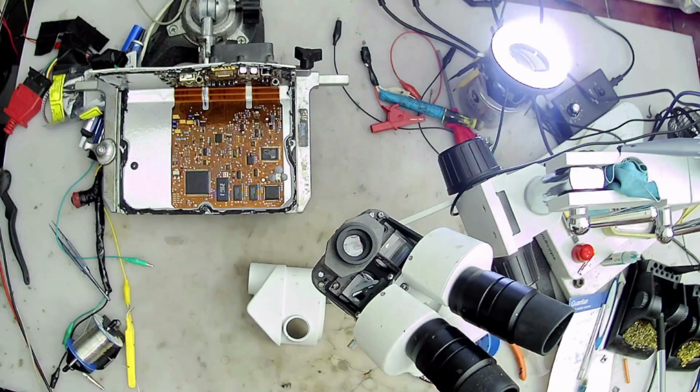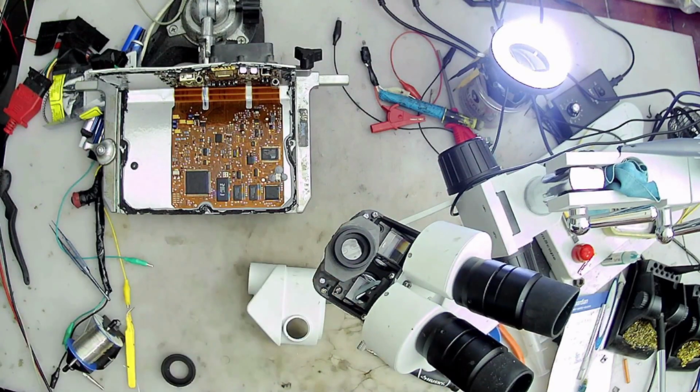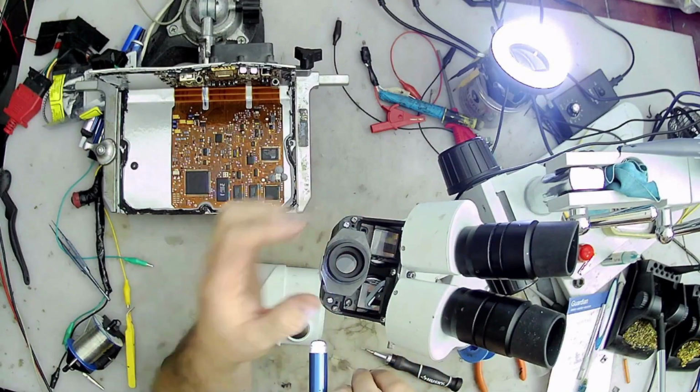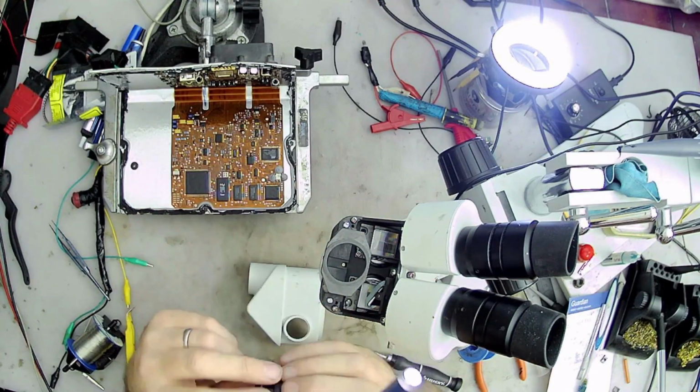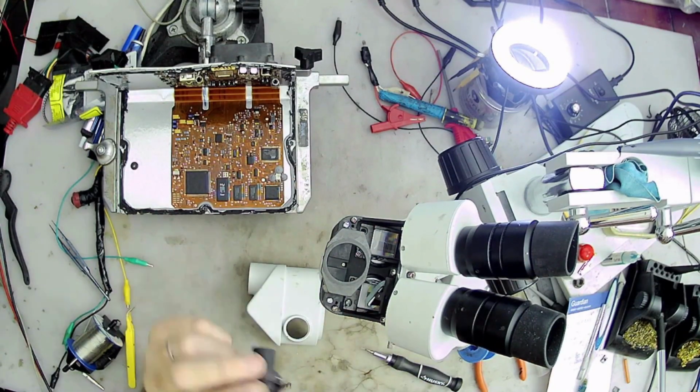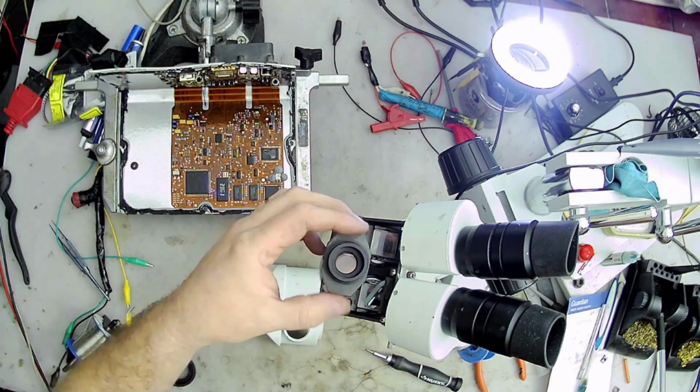So there's one thing we do need to make sure we line it up. And the only way I could think to line it up was to put the camera in, and I was going to try to view it, and me, I don't know nothing about optics. That took me a second to realize that it's too much light coming into the scope that you couldn't see anything, so I had to put the case back on, and we'll see that here in a little bit.